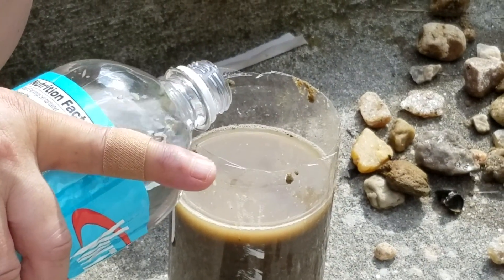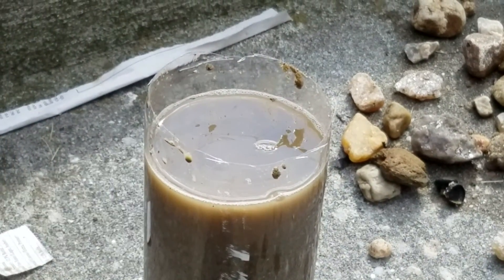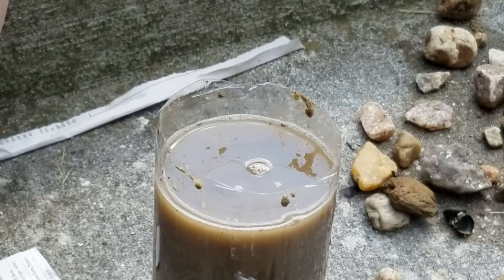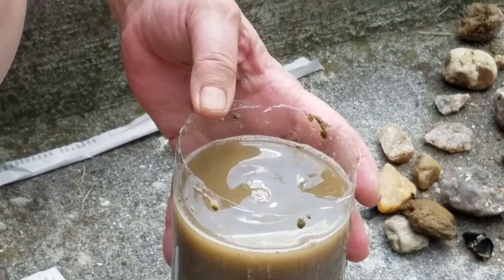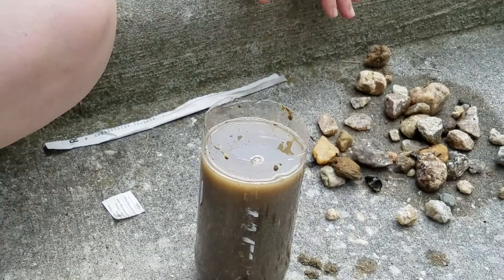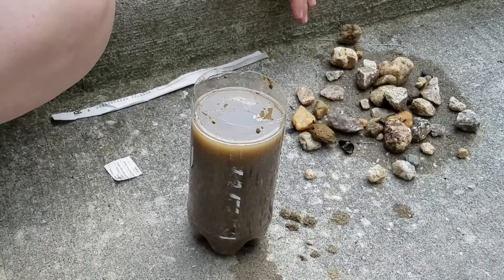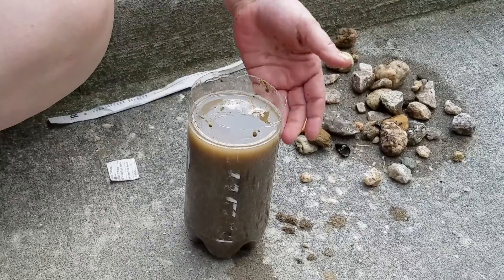We're going to add some water — about an inch of water — and we're going to leave about an inch of space at the top. We'll cover this with some saran wrap and a rubber band. We do want some air to be able to get in there. We'll put it into a sunny window where it can get good light and leave it undisturbed.